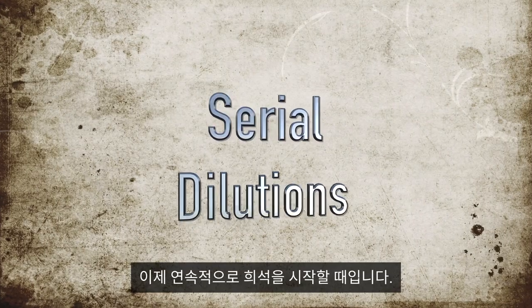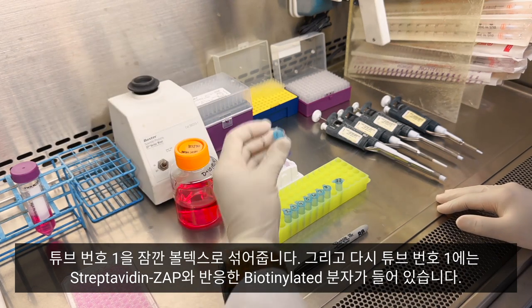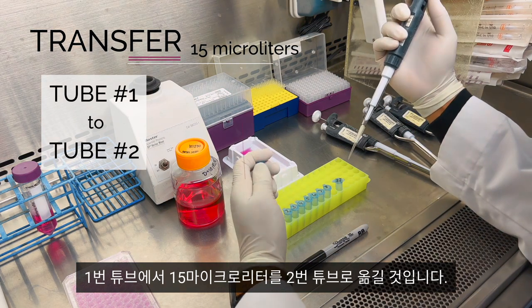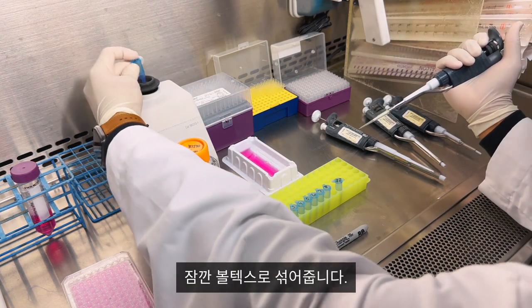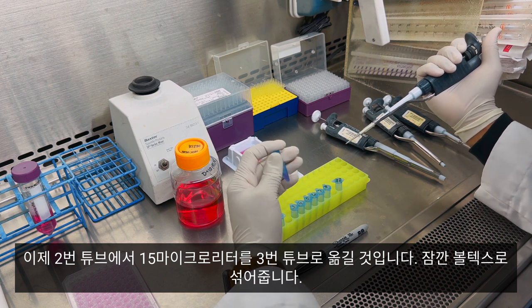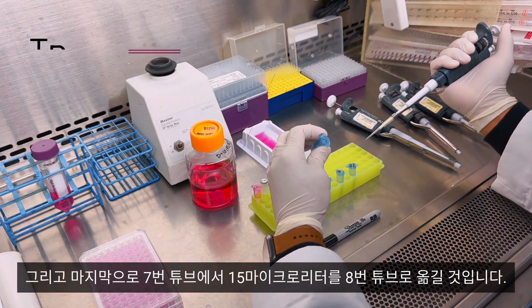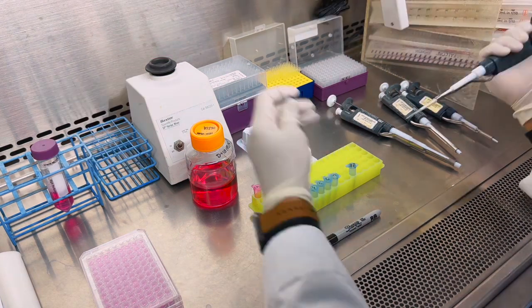Now it's time to begin the serial dilutions. Take tube number one and vortex briefly. Tube number one contains your biotinylated molecule that's been reacted with streptavidin-ZAP. From tube number one you will transfer 15 microliters into tube number two. Vortex briefly. Now from tube number two you will transfer 15 microliters into tube number three. Continue this pattern, and lastly from tube number seven transfer 15 microliters into tube number eight. Vortex briefly.